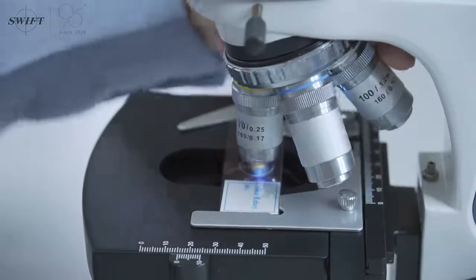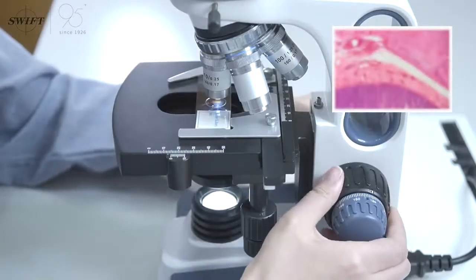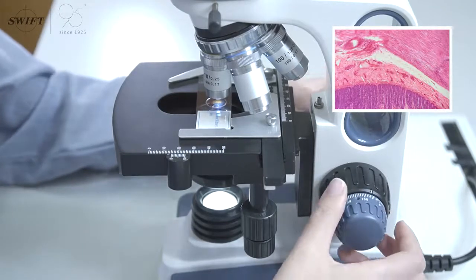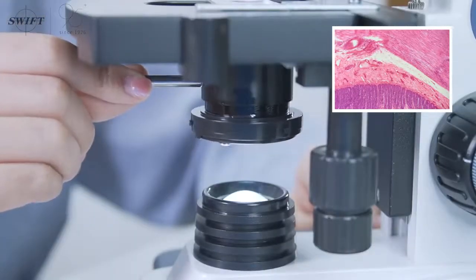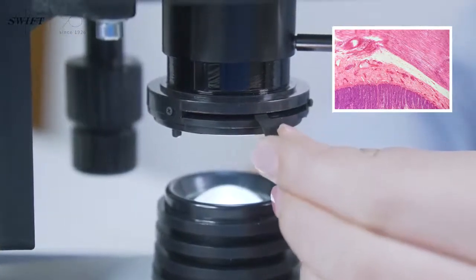Convert the magnification of the objective lens to observe with a low power objective lens. After adjusting the image under the mirror with the fine tuning hand wheel, adjust the condenser lens and aperture diaphragm to improve the contrast and sharpness of the image.